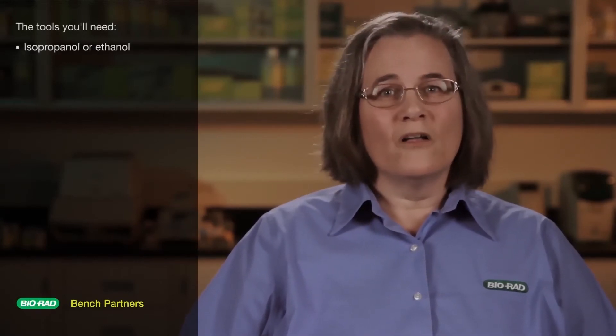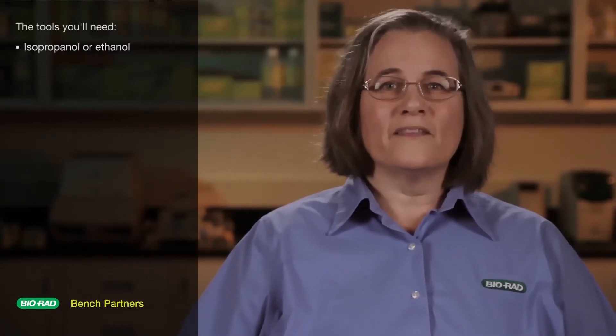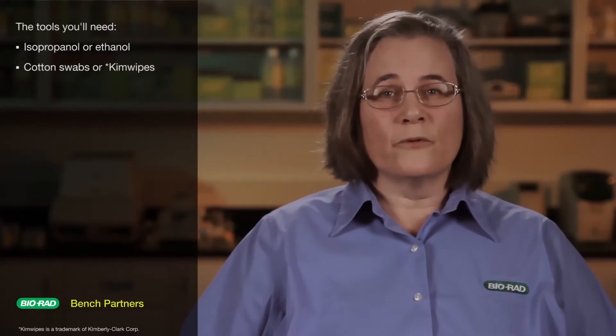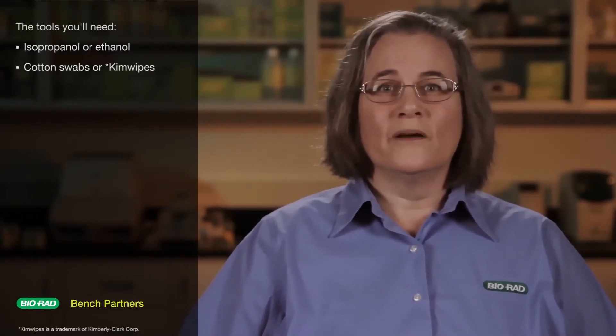Before we start, let's assemble the tools you'll need. 99% isopropanol or ethanol, and if you don't have isopropanol in the lab, you can pick some up at the local drugstore. Cotton swabs, if you don't have cotton swabs handy, Kim wipes will do. And gloves.